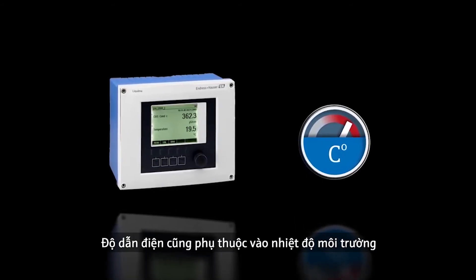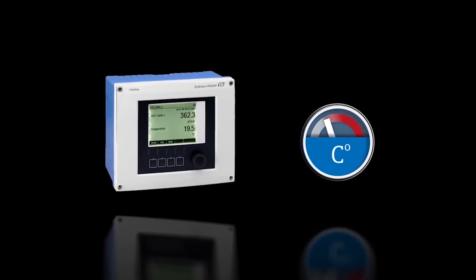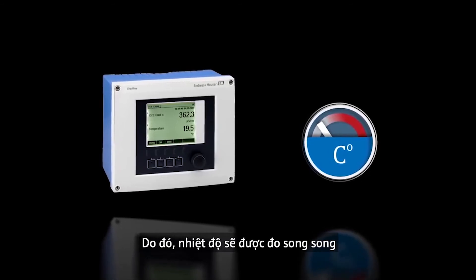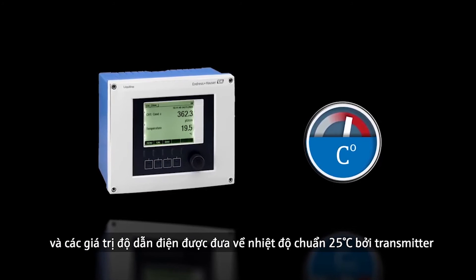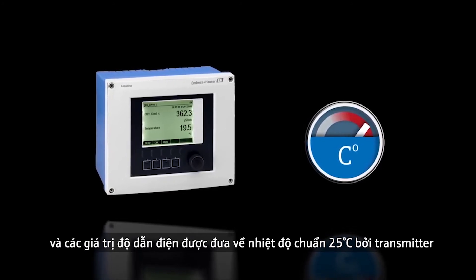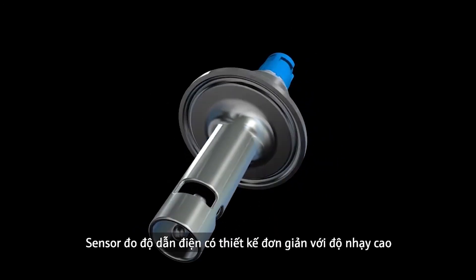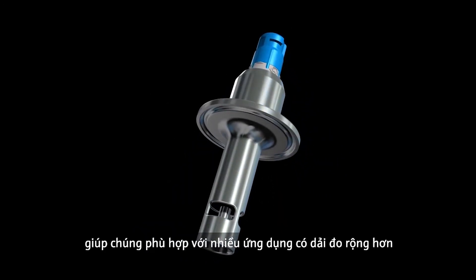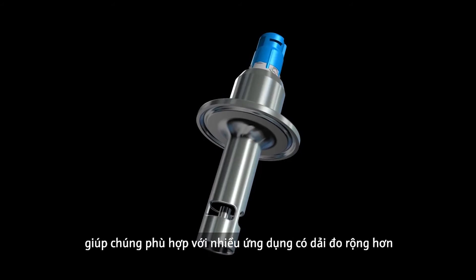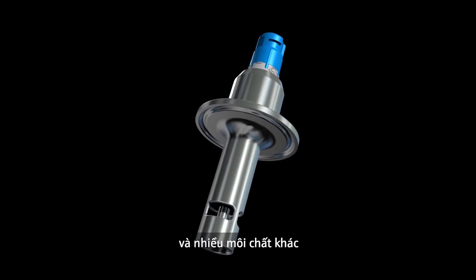Conductivity is also dependent on the medium temperature. Therefore, the temperature is measured in parallel and the conductivity values are referred to a reference temperature of 25 degrees Celsius by the transmitter. Conductive sensors have a simple design and are highly sensitive, which makes them suitable for a wide range of applications, from ultra-pure water to drinking water and more.